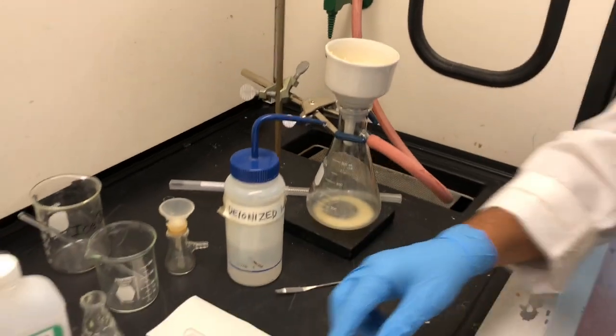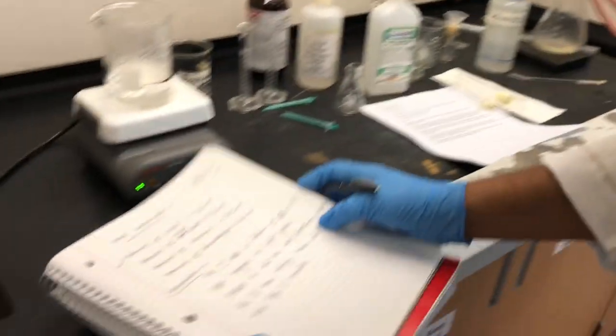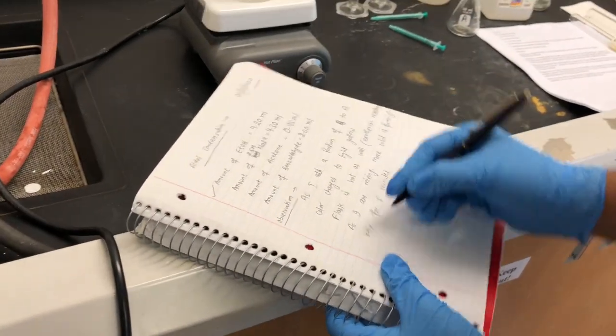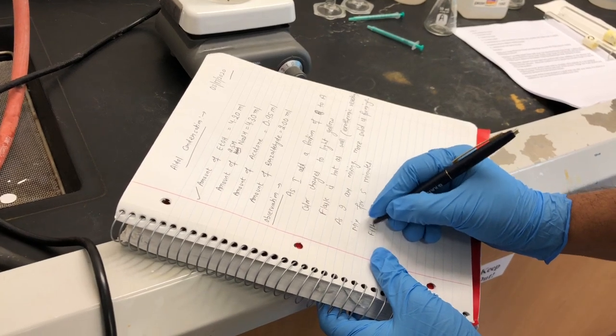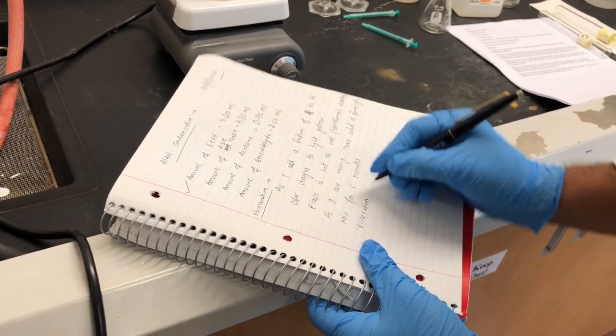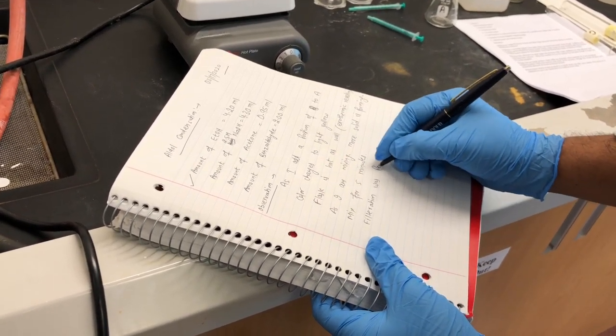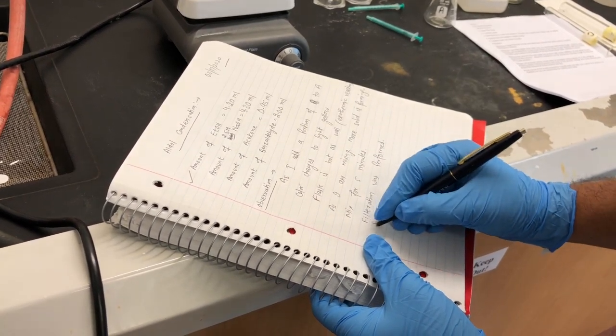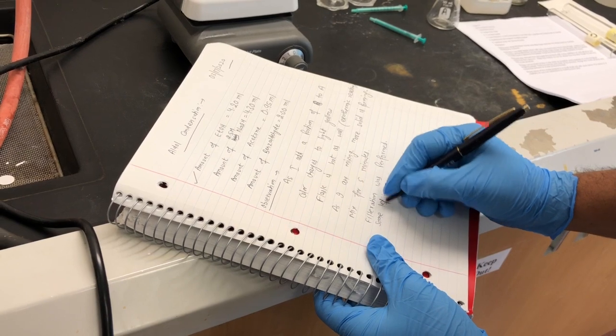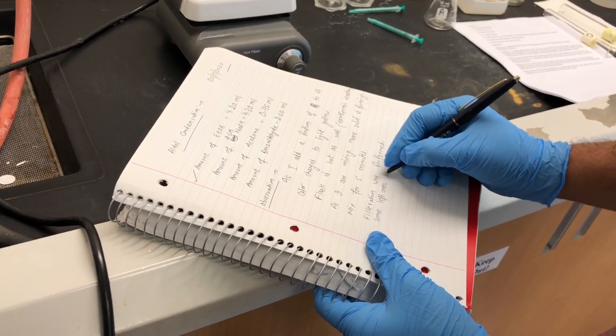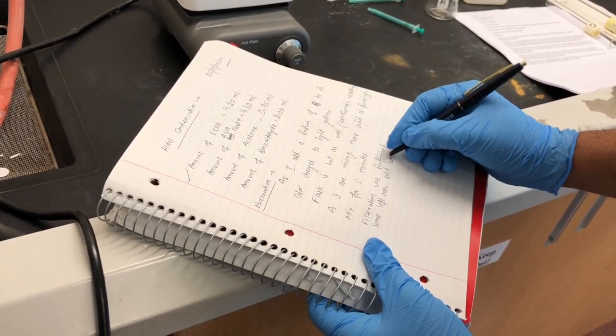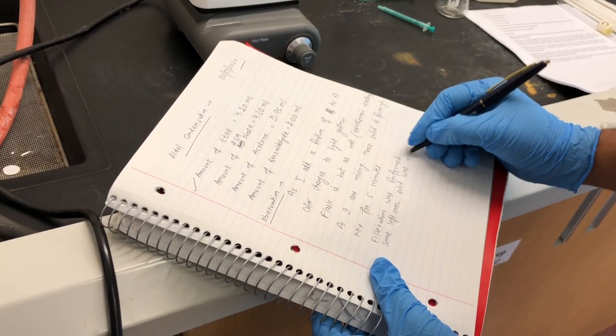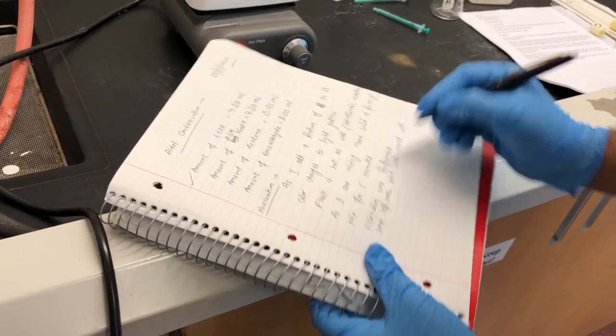And this is a crude product. The meaning of crude is it is not pure. We might need to purify this product. However, I first want to write all my observation in the notebook. I will be sharing all my observations with you all.